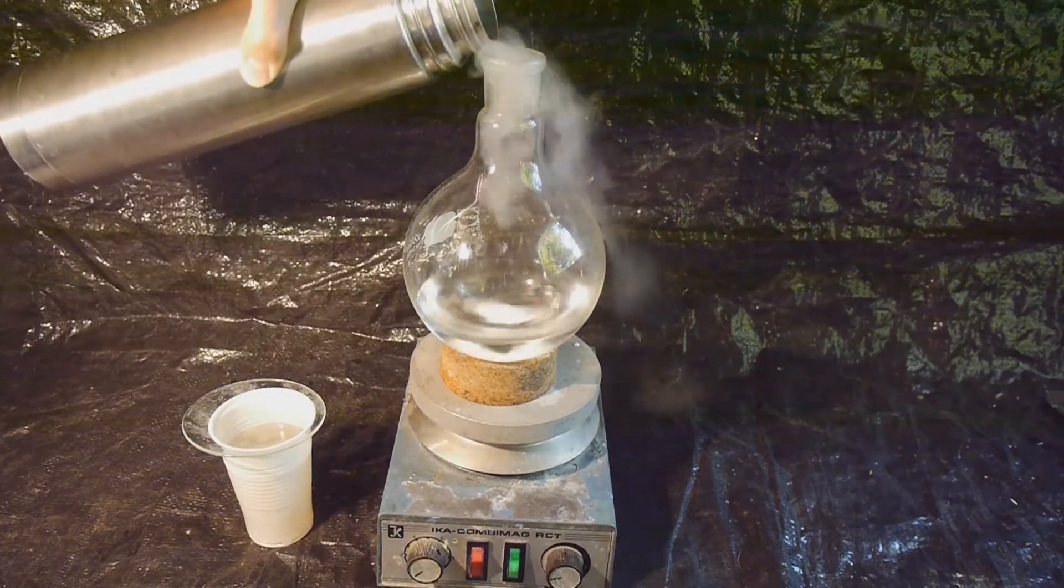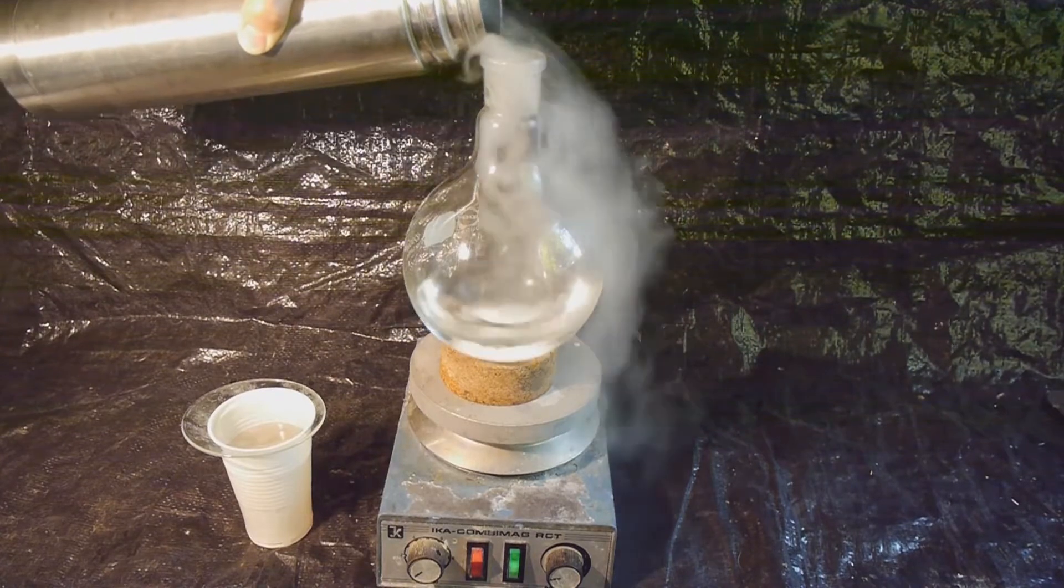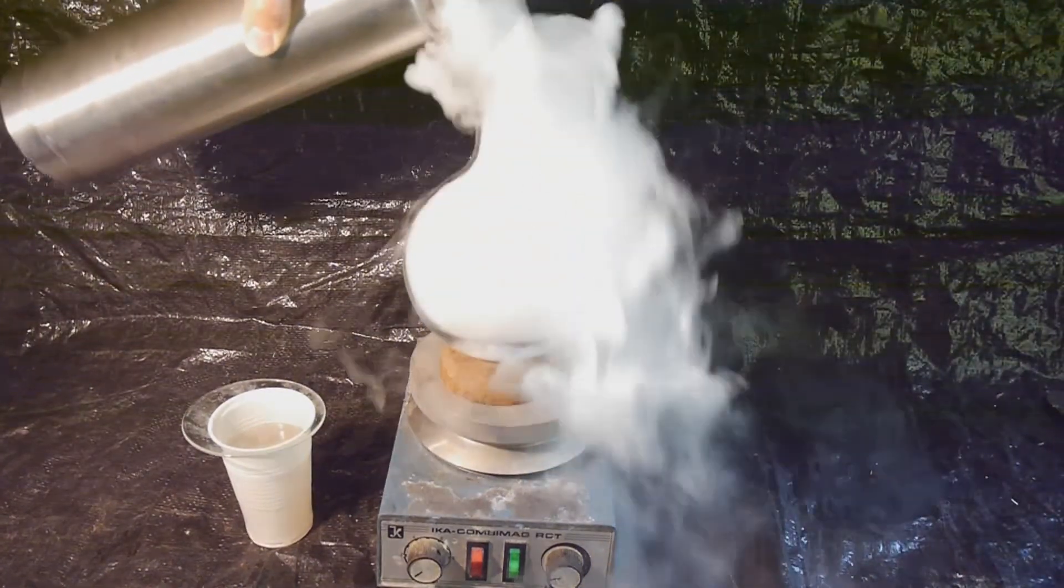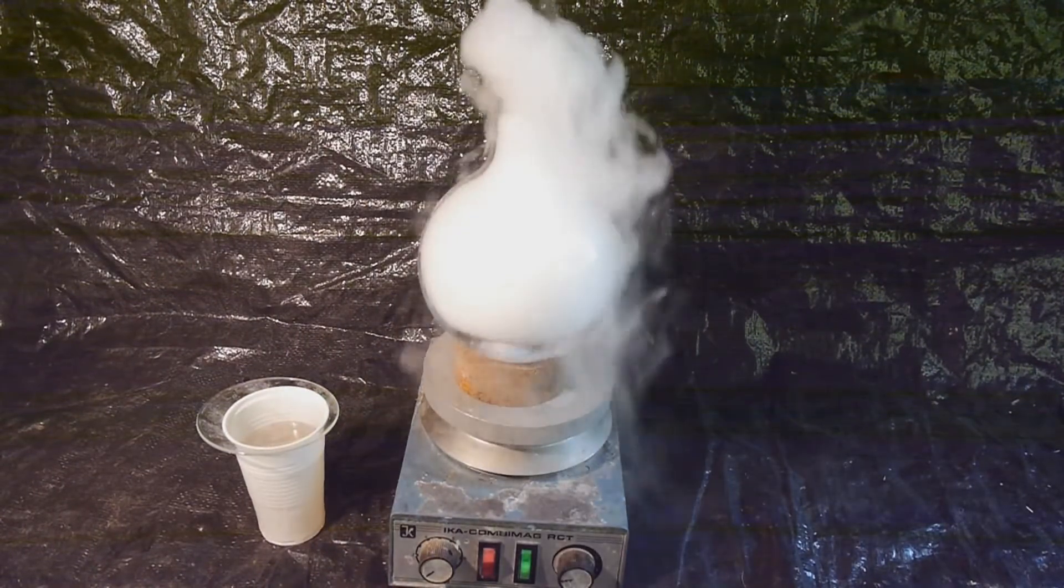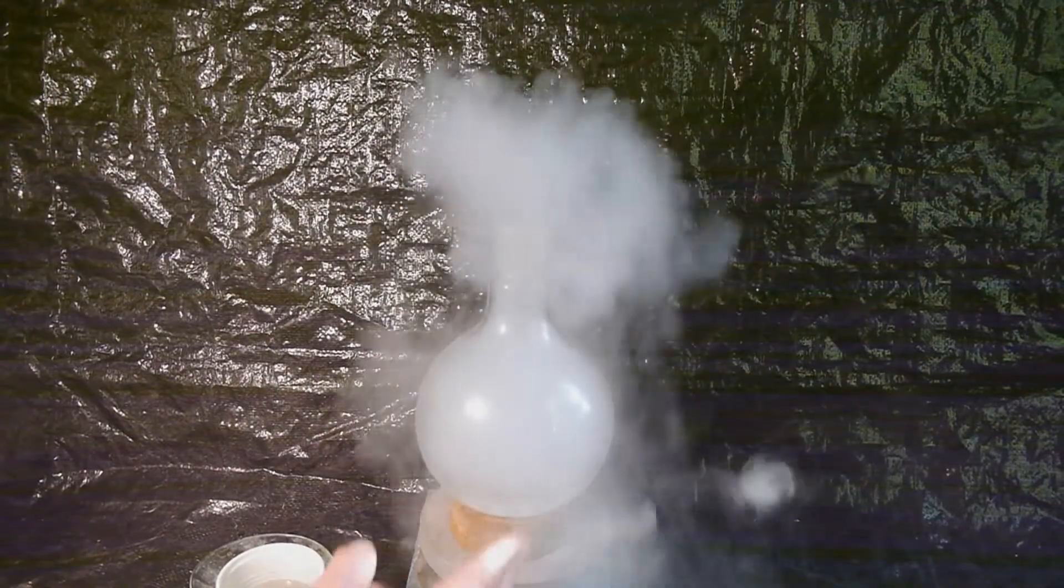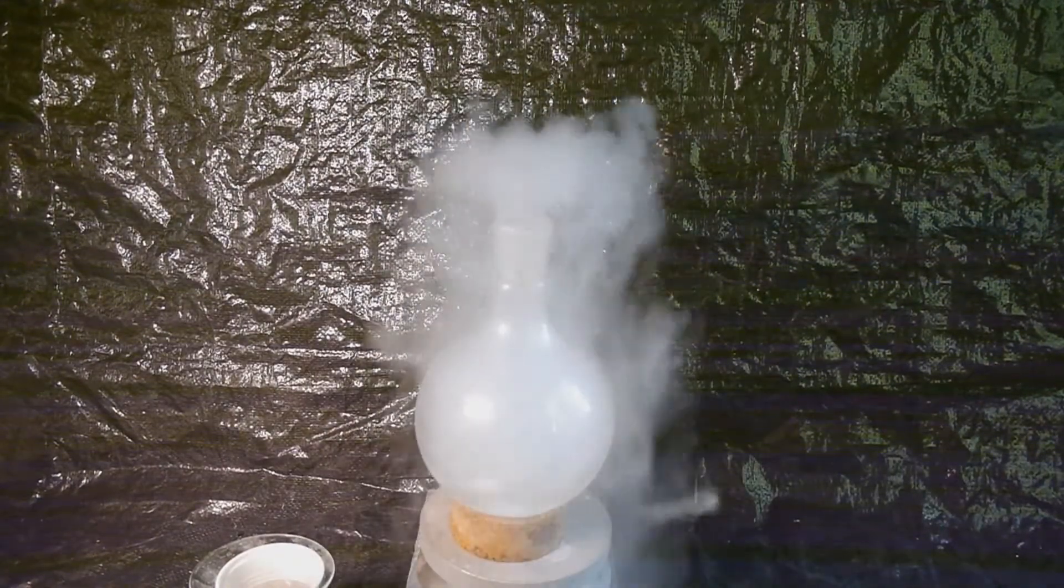Whoa. So let's just pour some in. Also it looks cooler and is faster. This looks more like alchemy than real chemistry, but that doesn't matter. And now the ethanol is beginning to freeze.